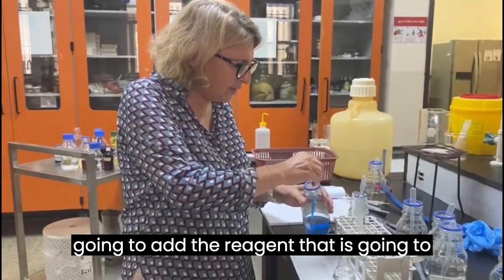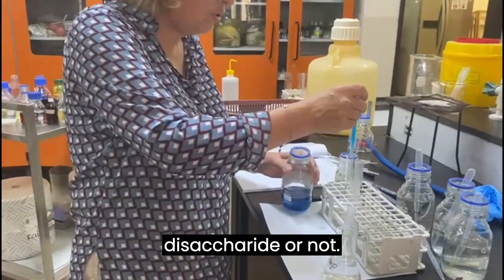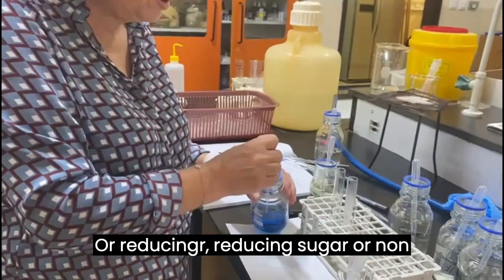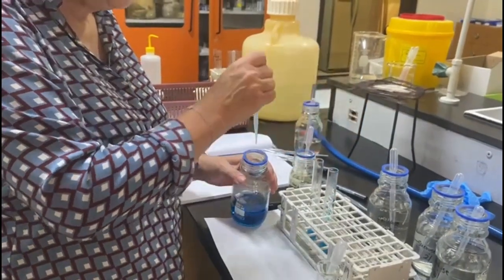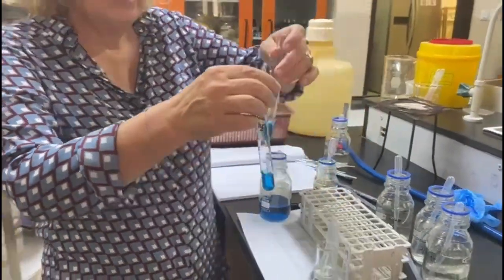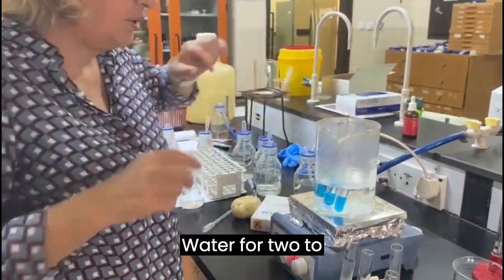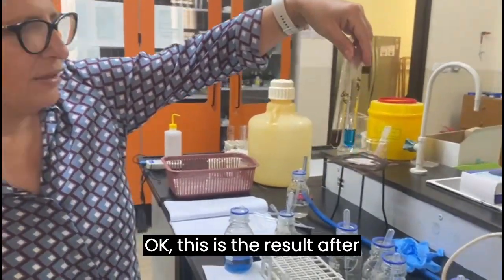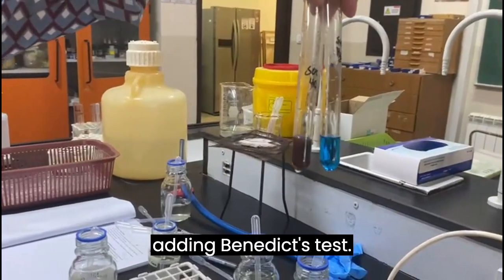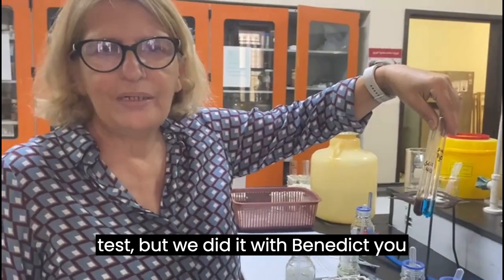I'm going to add the reagent that is going to show me whether I'm dealing with the disaccharide or not, or with the reducing sugar or non-reducing sugar, which requires, as you remember, putting it in the water for 2 to 3 minutes. Okay, this is the result after adding Benedict's test. Now in your manual it says Barfoed's test, but we did it with Benedict.